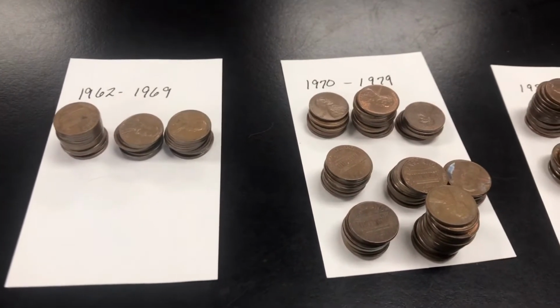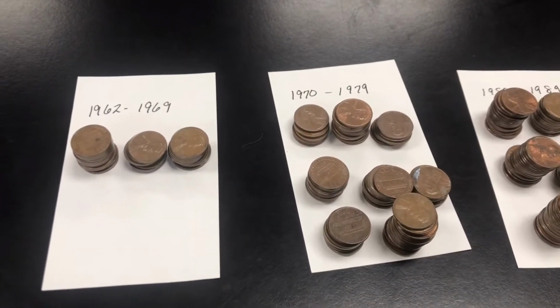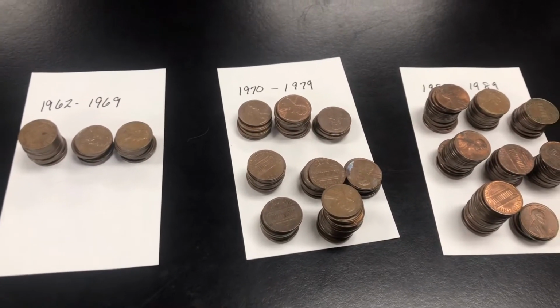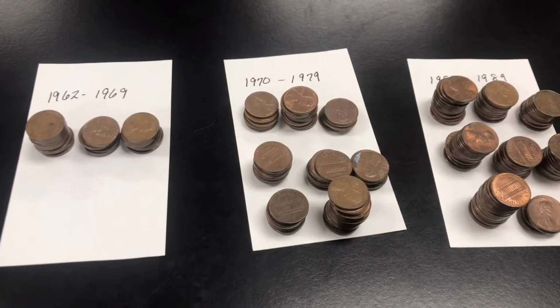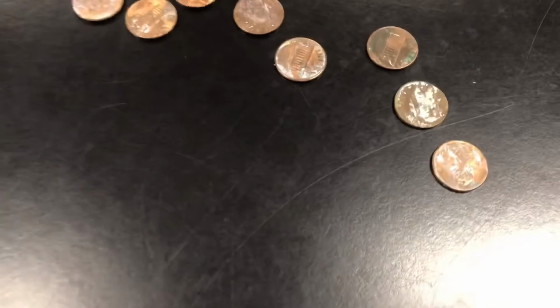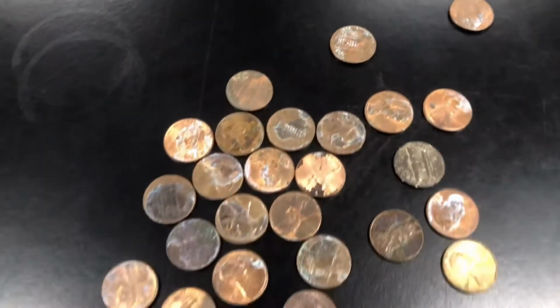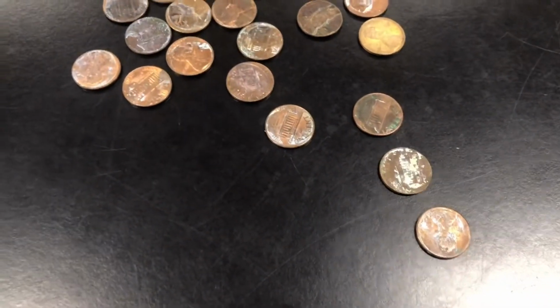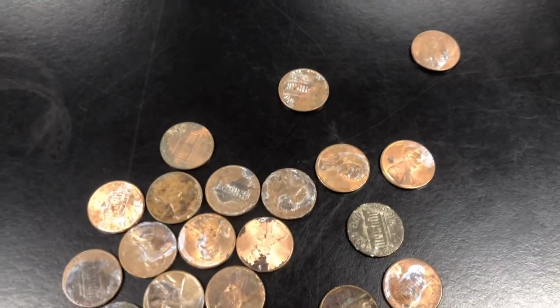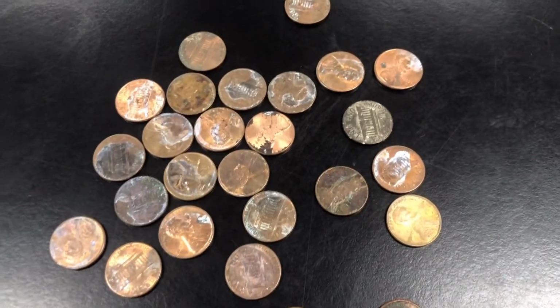At this point, you're going to need to go ahead and get some paper, and you're going to have to start recording some of these pieces of information down when we take these measurements, because I'm not going to tell them to you. This is going to be in your lab. Before we even get to measuring the mass, I want you to take a look at some of the pennies I did not use. You can put into your explanation at the end of the write-up why these would not have been used in the data and how that could have affected our accuracy and the results that we get.